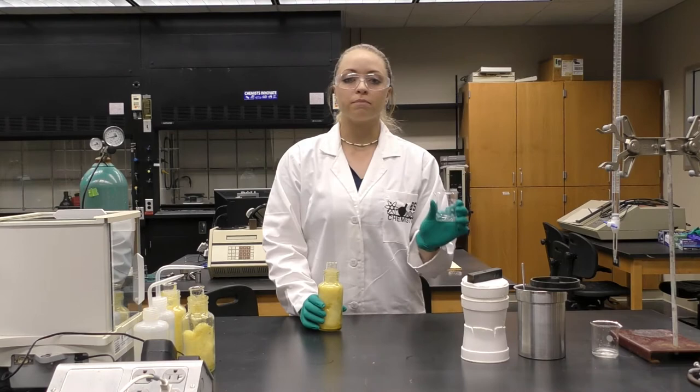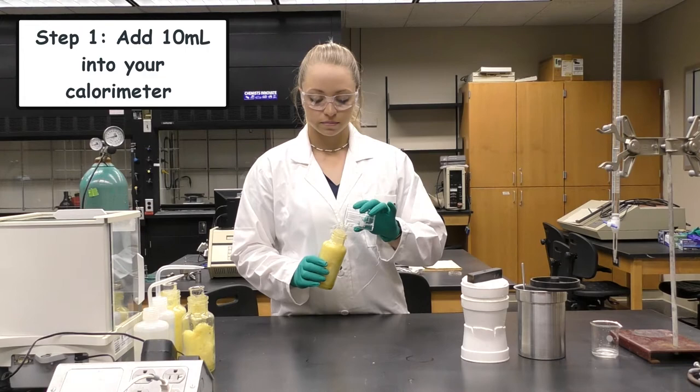To begin this experiment, you will want to measure out 10 milliliters of water. You will put that 10 milliliters of water into your calorimeter.